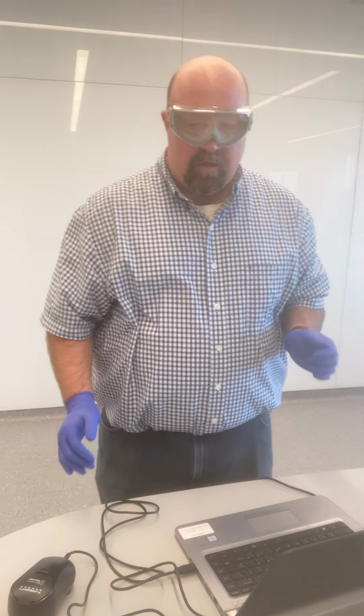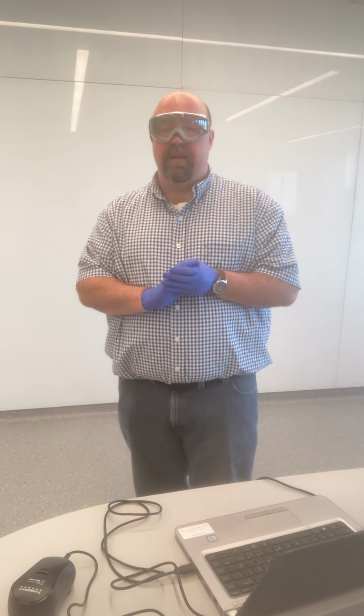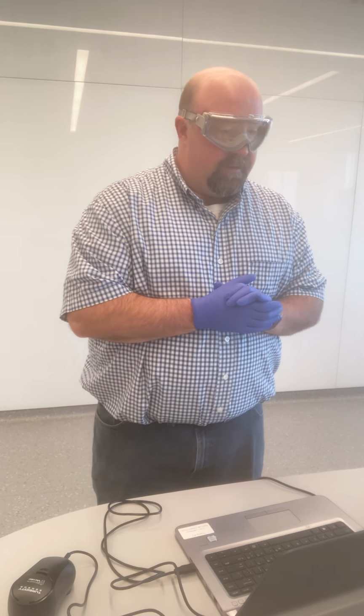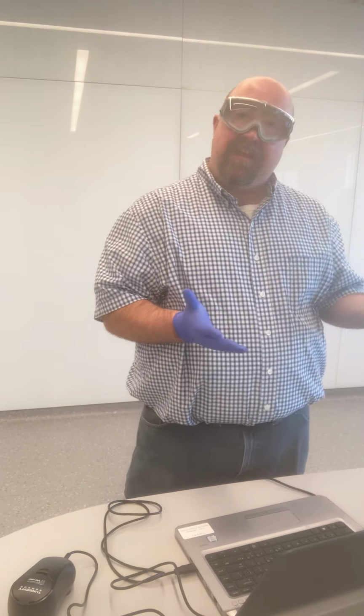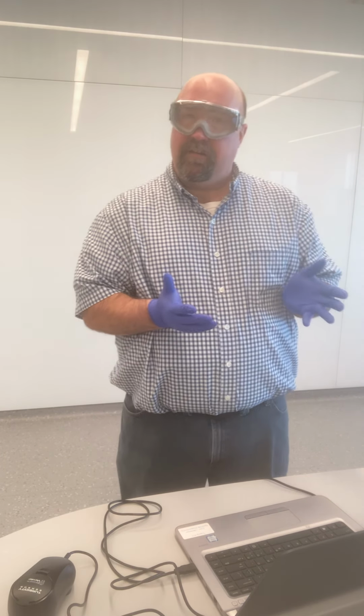Hi all, and welcome to Module 1 of CHY 114. Today we are measuring the TSS and turbidity of the 5 different Green River sample spots. And so we're going to begin with looking at our TSS. Remember that TSS is the total suspended solids.